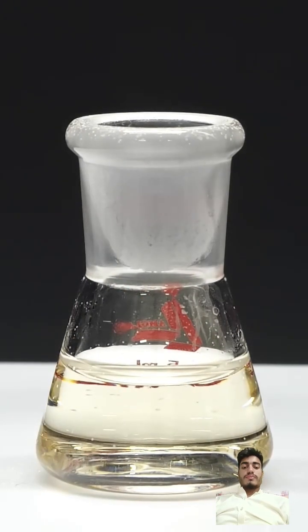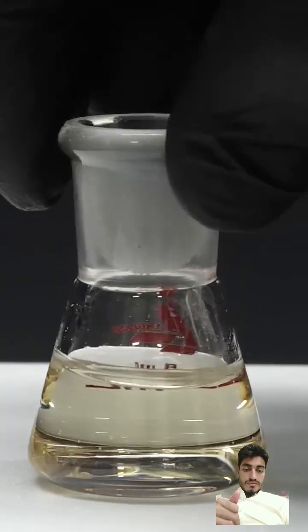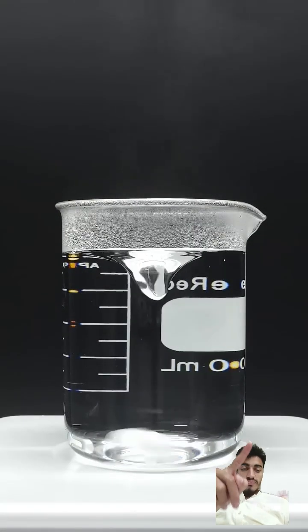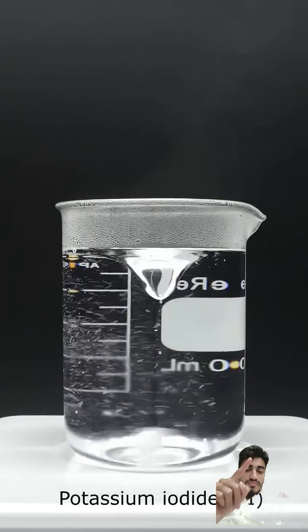So now, it's done, and I'll just temporarily put this to the side. What I have to do next is get a beaker, and add some boiling water, and a small amount of potassium iodide.